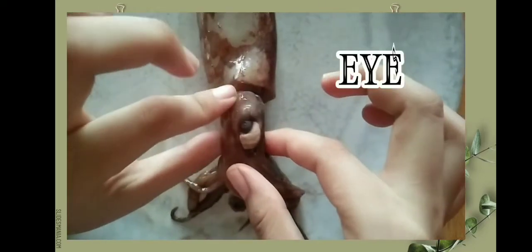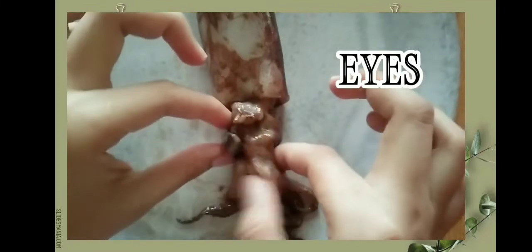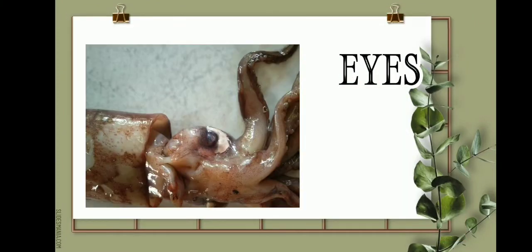And of course, their eyes. Their eyes are really big. Just like other animals, they use their eyes to catch their prey. Their eyes have built-in contact lenses which they use to protect their pupils and to focus more on their prey.